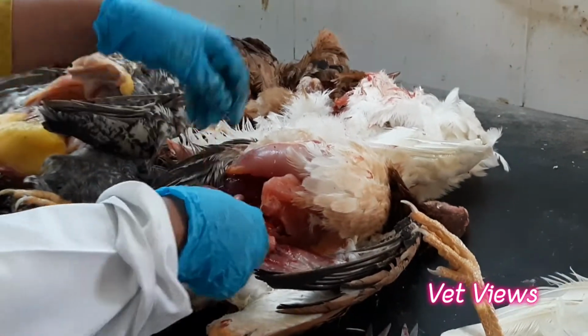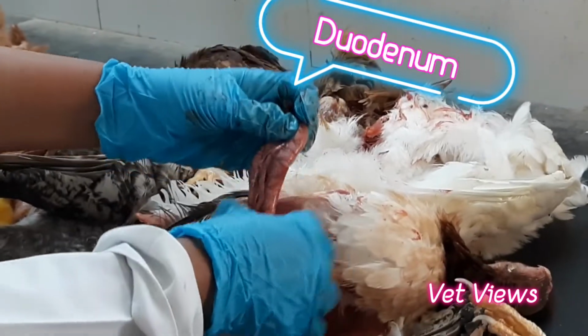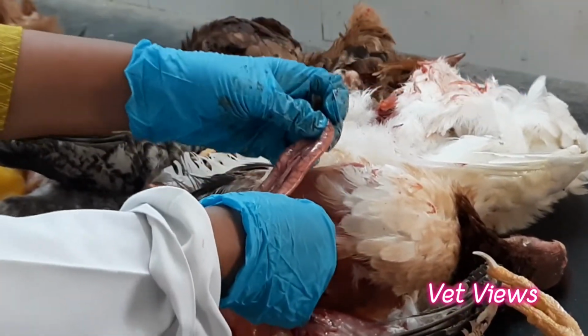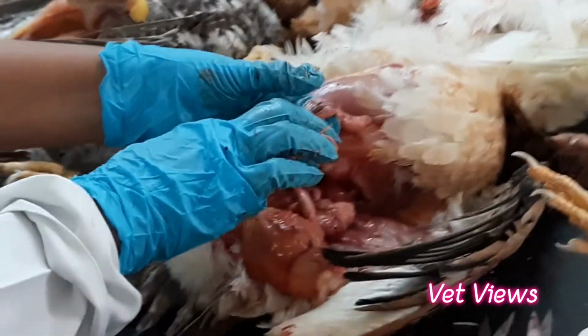So this is called the duodenum. The start of the small intestine is the duodenum. This is a duodenal loop. In between the duodenal loop, this is the pancreas. The texture of the pancreas is very important.